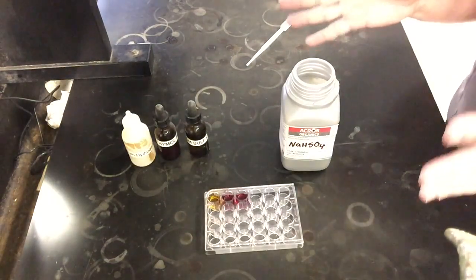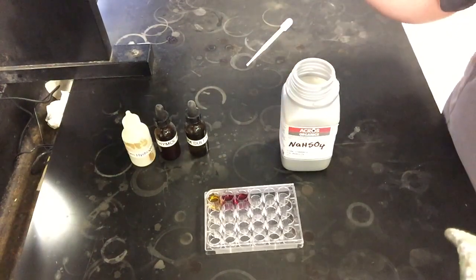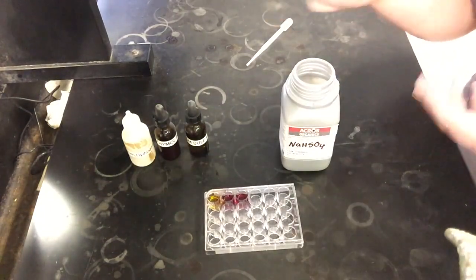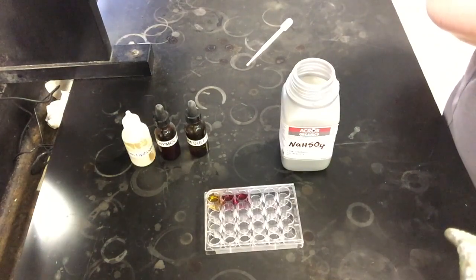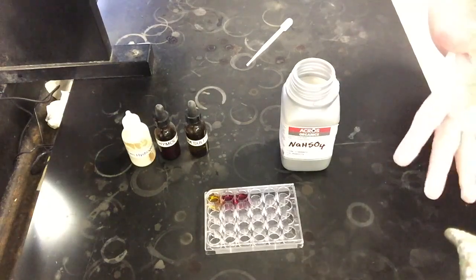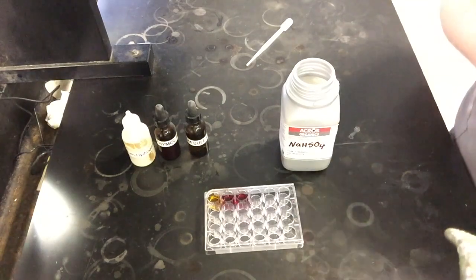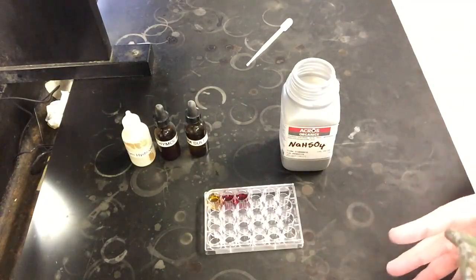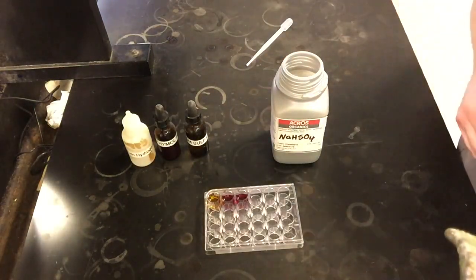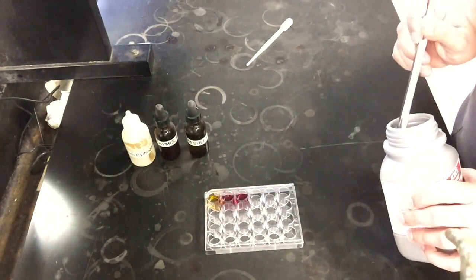And so what I'm going to do from here, for the rest of this part of the experiment and our next reactions, is mainly just add the reaction component we're asked to add, observe the color change, and help you to figure out what color we've seen. But then I'm going to let you guys think about reactants, products, what's been added, or what side reactions we might have caused that make us create either more reactants or products. I'm going to leave that a little bit more up to you guys as you're going through this, because that's really the point of this whole experiment. The experiment itself is going to go pretty quick as I get going, and it's really the thought process that helps analyze and think about why we're seeing some of the changes that we're seeing.